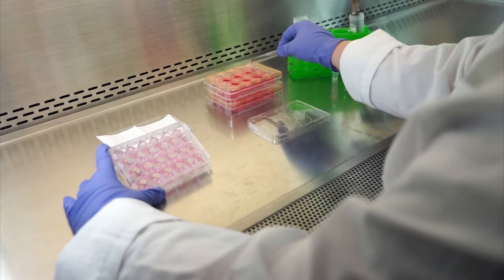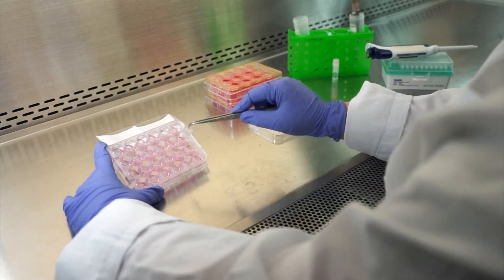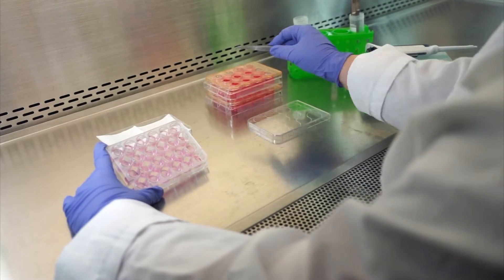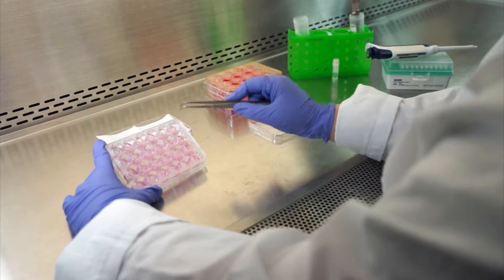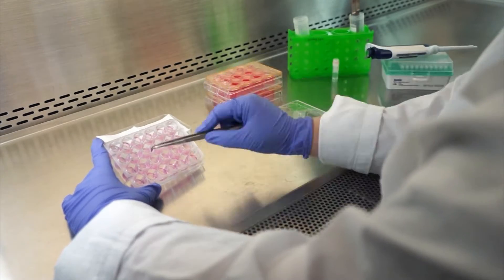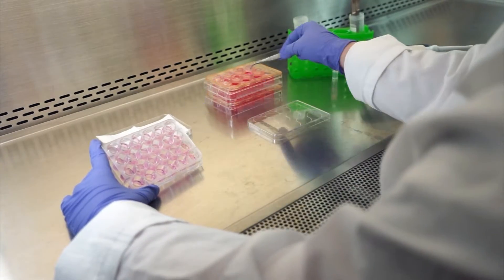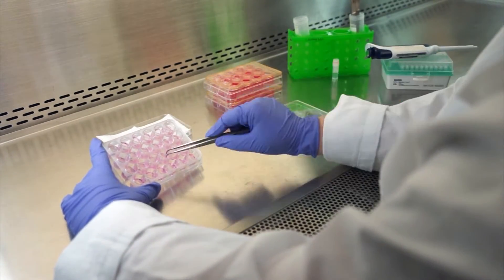After the culture period, the tissues are packed in a 24-well plate with the media and agarose mixture for shipping. Once the tissues have been received, the plate is removed from the plastic sleeve and plates are prepared with media for transferring the tissues.